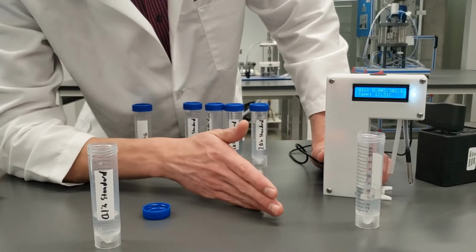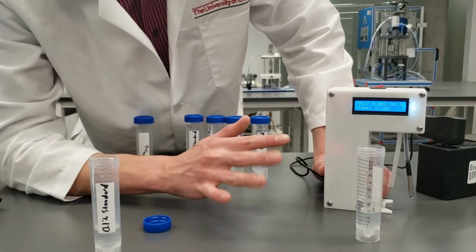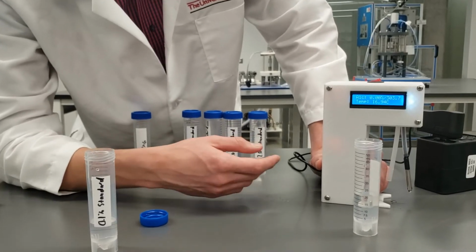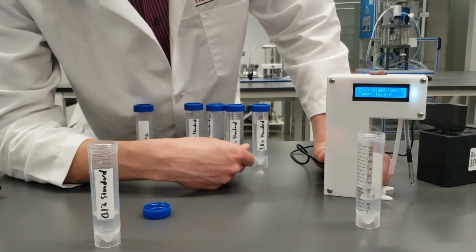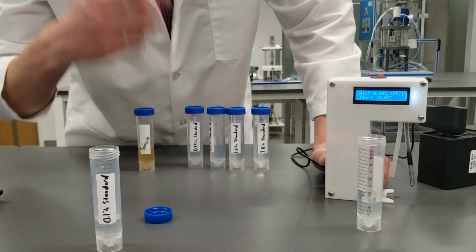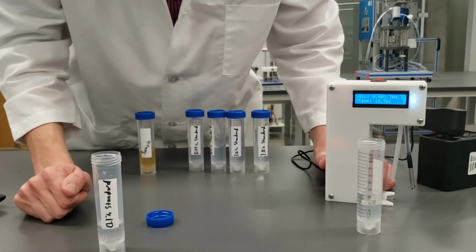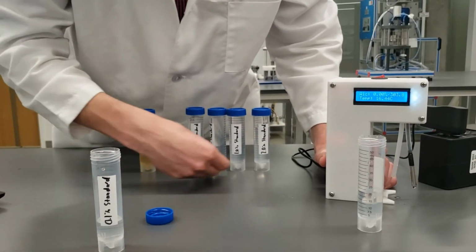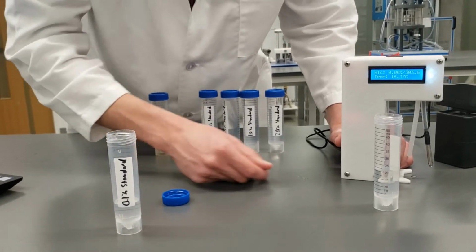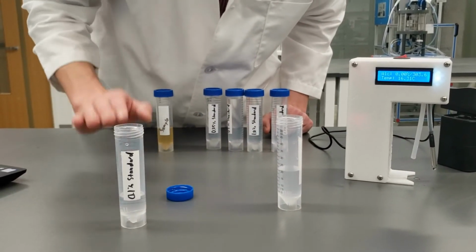So if you know that you'll be testing a lot of 1% alcohol or something around 1%, then maybe you want to choose your standards to be around there. So you might want to test 0.5, 0.75, 1, 1.25, and maybe 1.5 instead of the set that we have here. You can change that in the Excel document, of course, and the more standards you use around the alcohol percentage that you're testing, the more accurate the detector will be. So again, we're going to test all these samples, and we'll be back with the results in the graph.